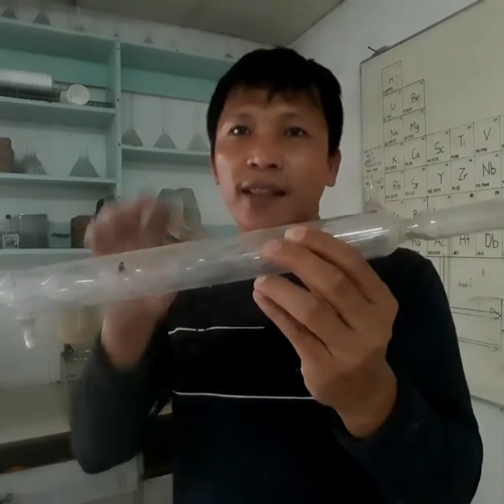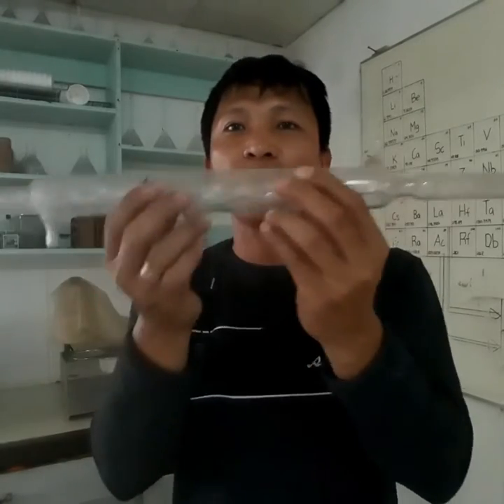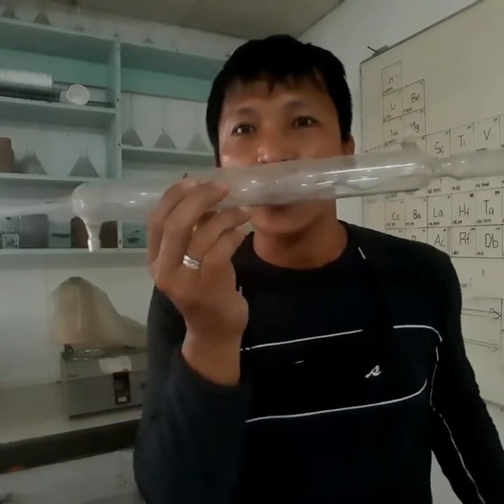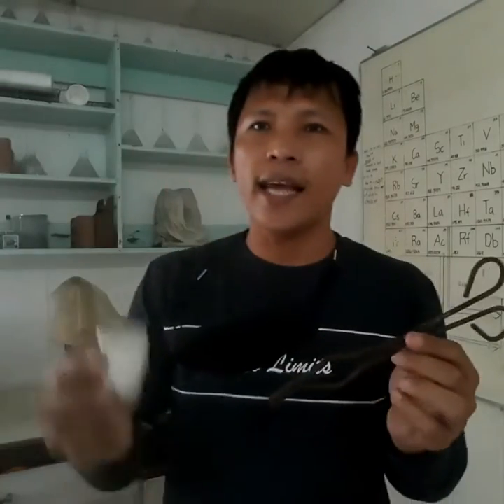The details of condensation are not part of this discussion because I'm just introducing the tool. Okay. Next item in the list is a crucible.